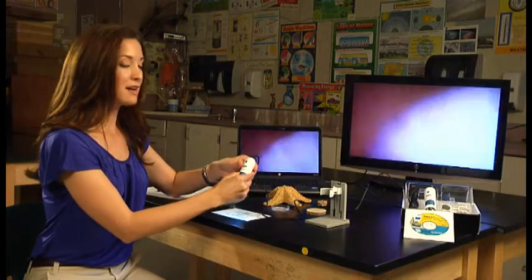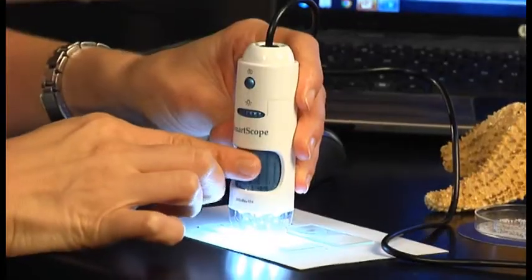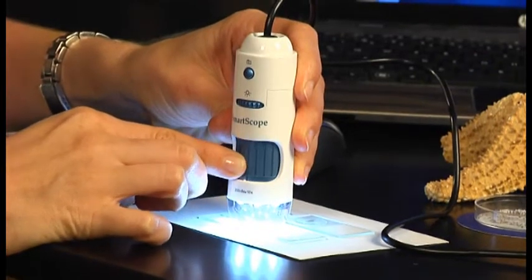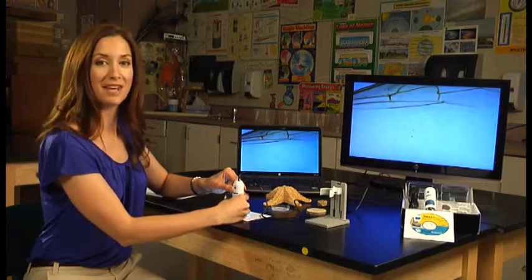You'll want to make sure that the focus dial is turned all the way to the right before you place it on the slide. And then slowly turn it to the left. You can see the first time it comes into focus, we are at 100x magnification.